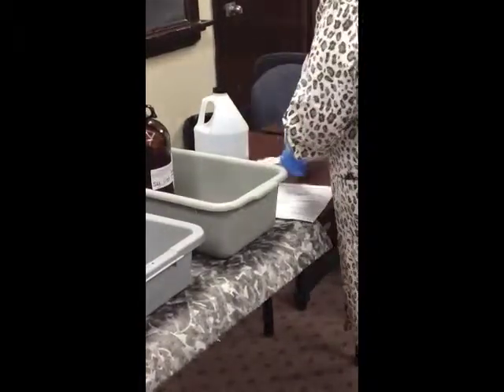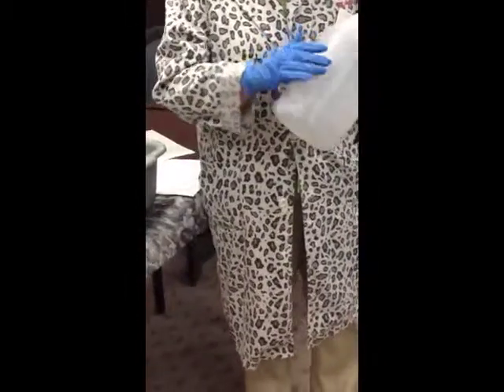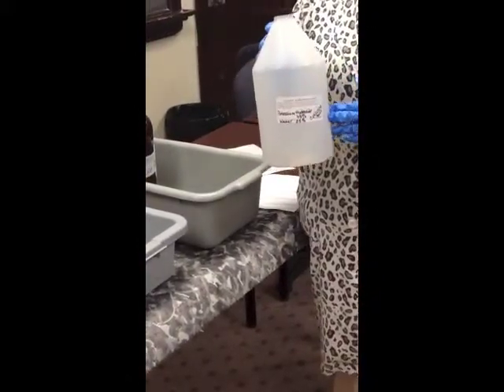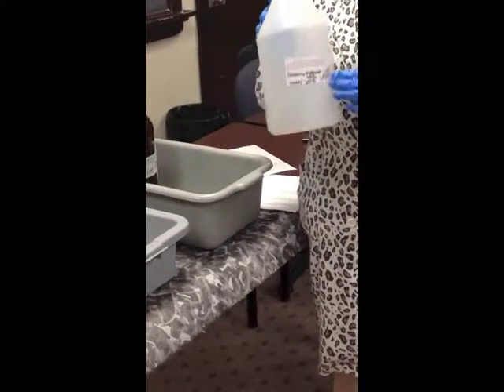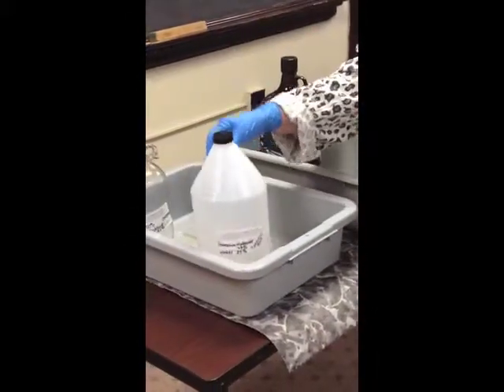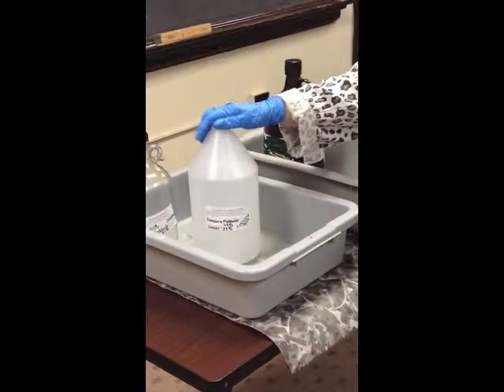Once you fill out the label, you need to attach it to your container. And this has to be attached when the first drop of waste goes into the container. Not when you're ready to declare it, but when the first drop goes in, be sure this label goes on with all applicable constituents in that container. Again, this is a basic, it's a hydroxide, so we're going to put it in our secondary containment area with our other hydroxide.